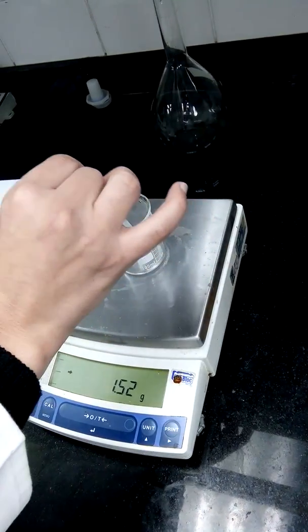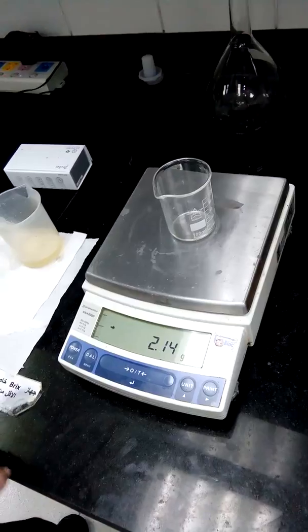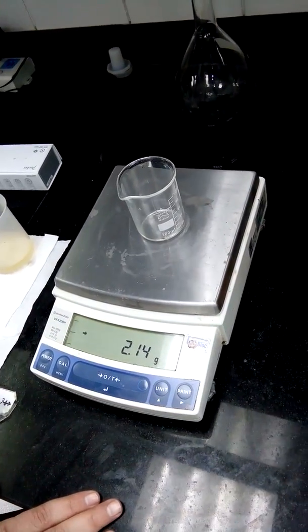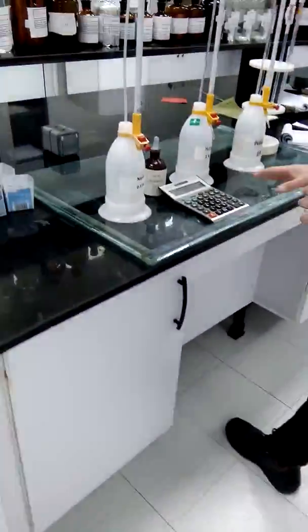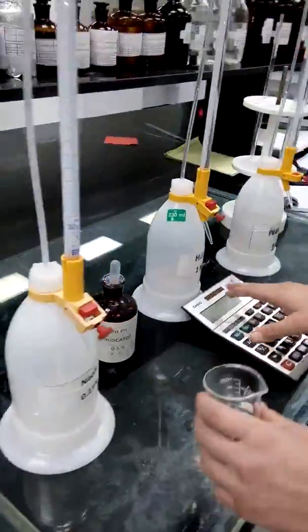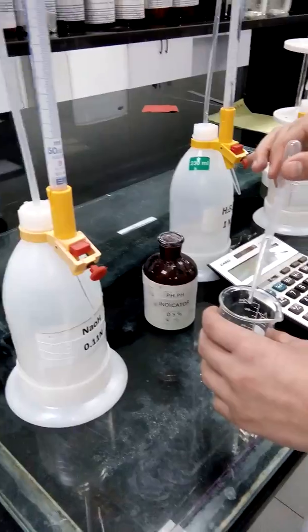To have a good amount of liquid, this is 2.14 grams. I add pH indicator 0.5%, 4 to 5 drops.